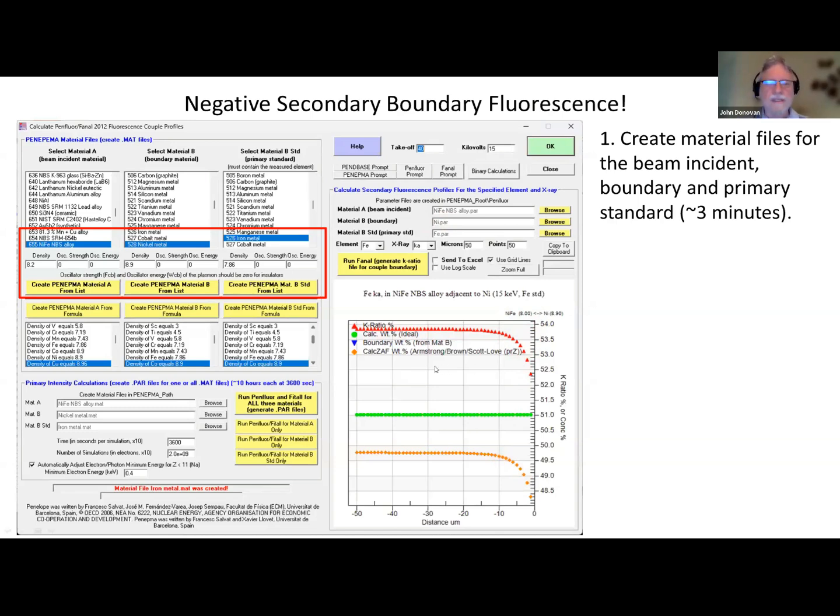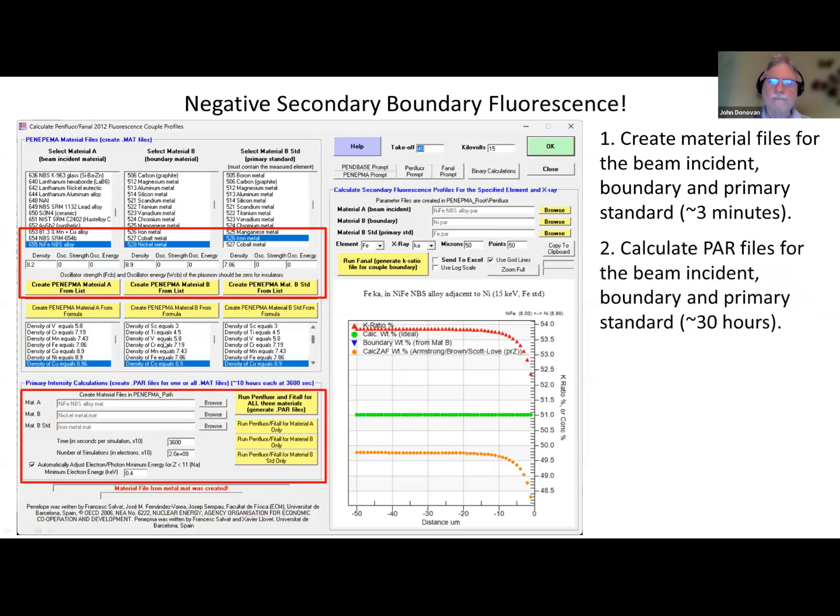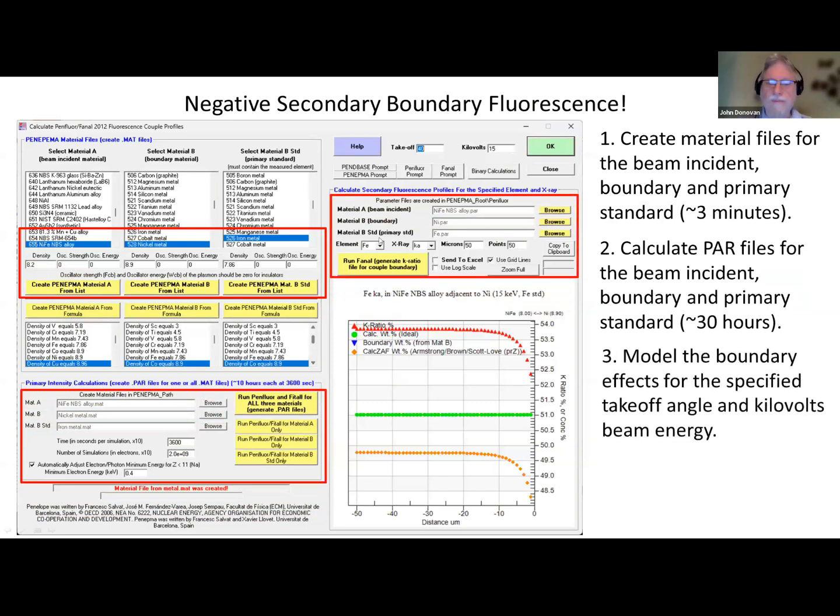But let me take you through the steps to run this, because this is in the free CalcZAF software. It's actually in the standard app, but it comes with the CalcZAF software. Basically, you need to create some material. Here's your beam incident material, your boundary material, and your primary. There are about 200 or 300 compounds already calculated in the distribution. When you download it, you get all the pure elements and a whole bunch of compounds, so you can start playing with it right away. If you have another material you want to add, you can either add it to your standard database, or just type in a formula and it will calculate it. Each of these takes about 10 hours to calculate, so 30 hours for all three materials. But once they're calculated, you can proceed to run the model, and it only takes a few seconds. You can edit the kilovolts, the element and X-ray, and get the calculation.